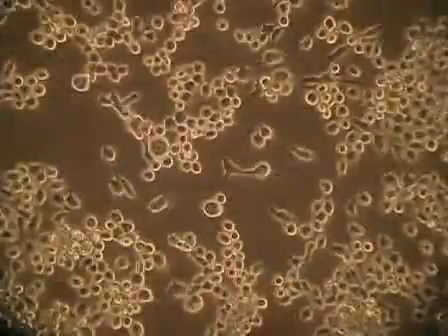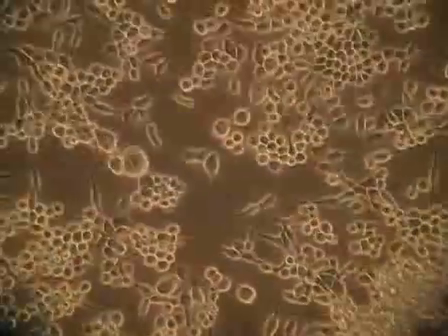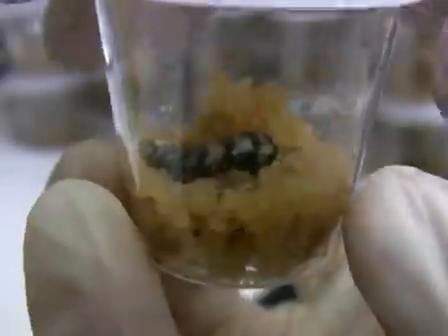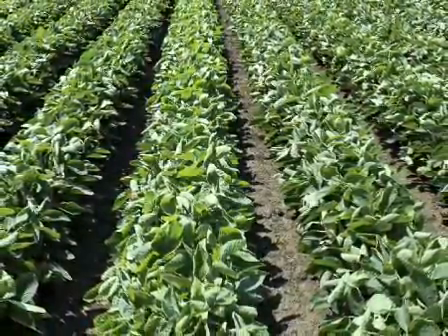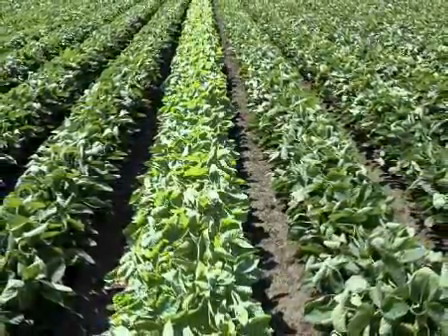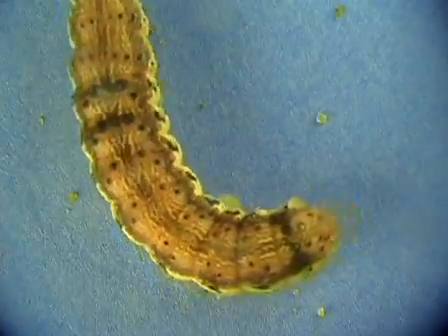The baculovirus is commonly used as a DNA vector in combination with insect cell lines for protein expression. However, the fact that this virus efficiently infects insects with lethal consequences also makes it an effective insecticidal agent. In Brazil, for example, wild-type baculovirus is applied to more than 1 million hectares of soybean crops annually for control of the velvet bean caterpillar.